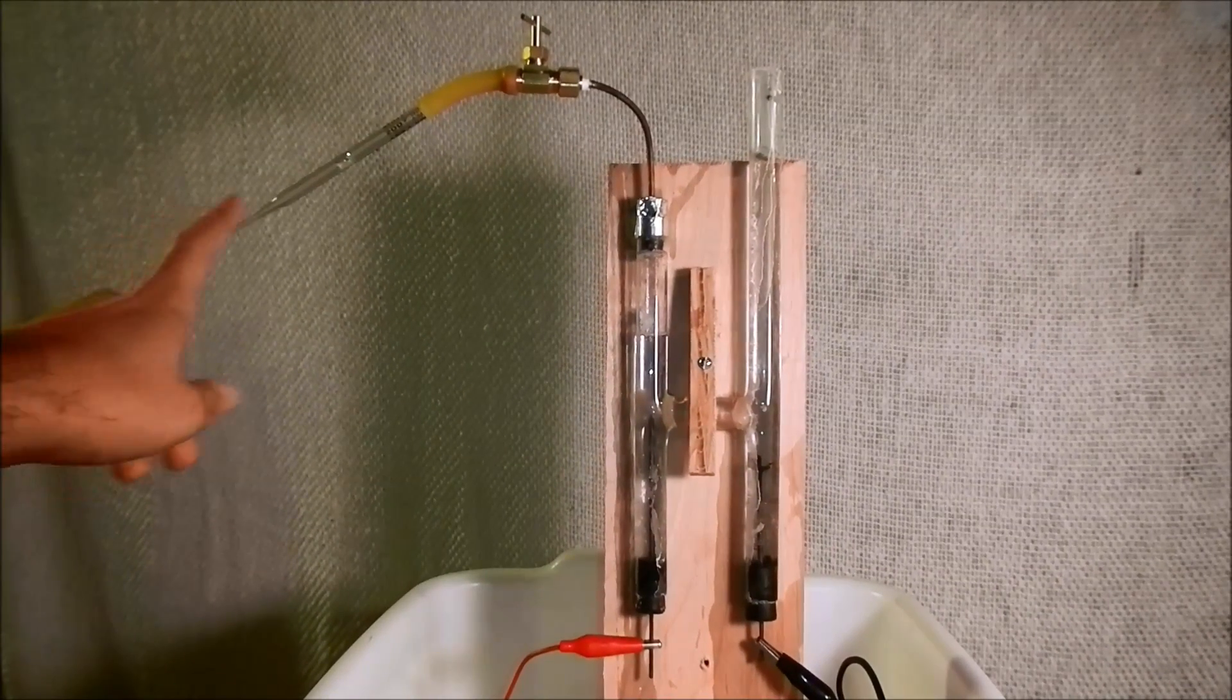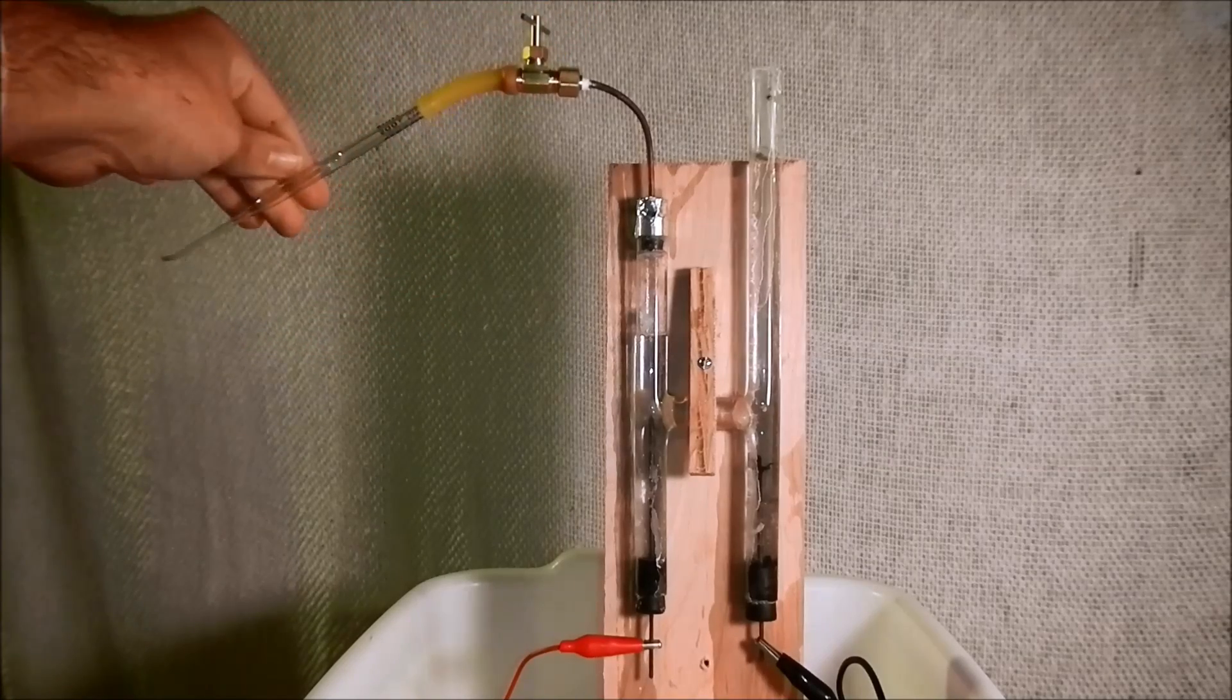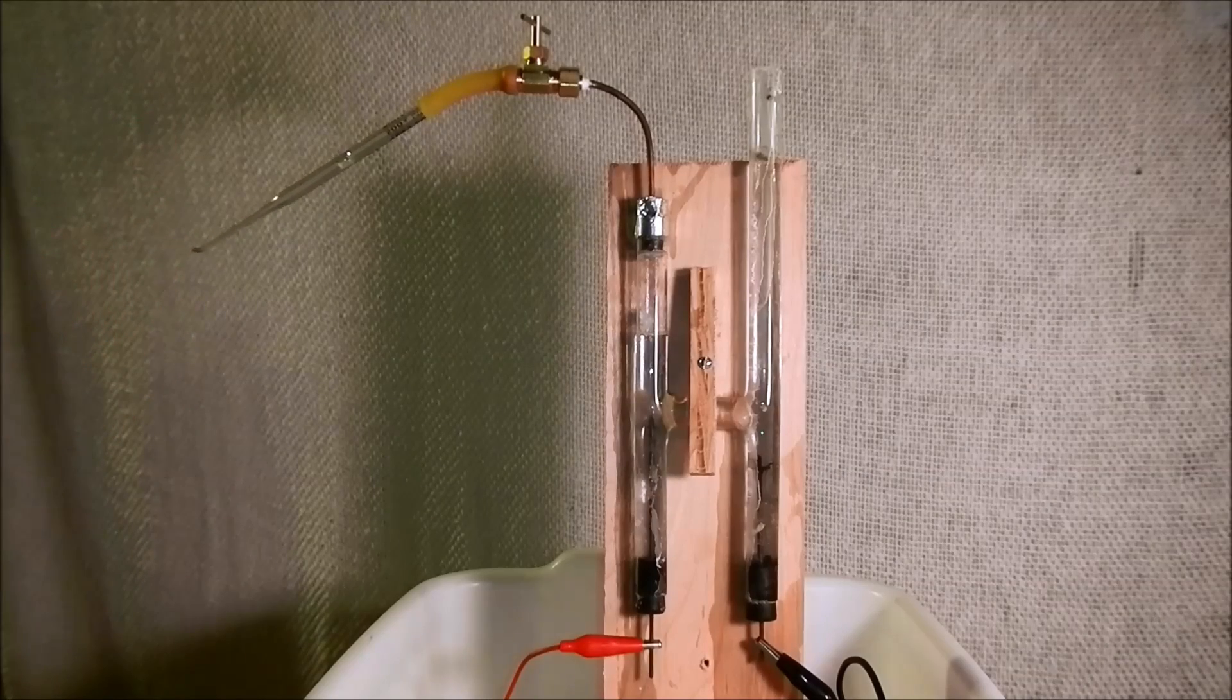And I have here a little valve and a little pipette here, and I can ignite some of the hydrogen that comes off.